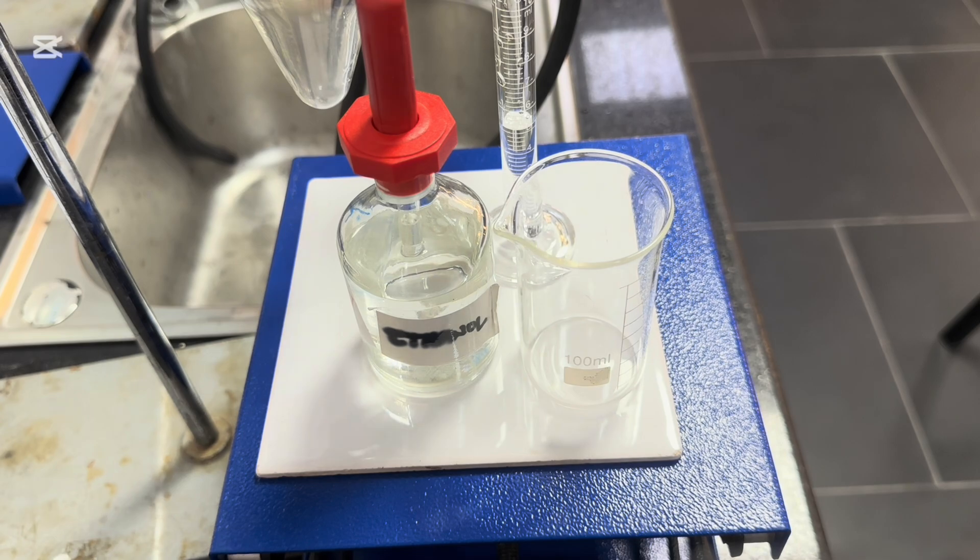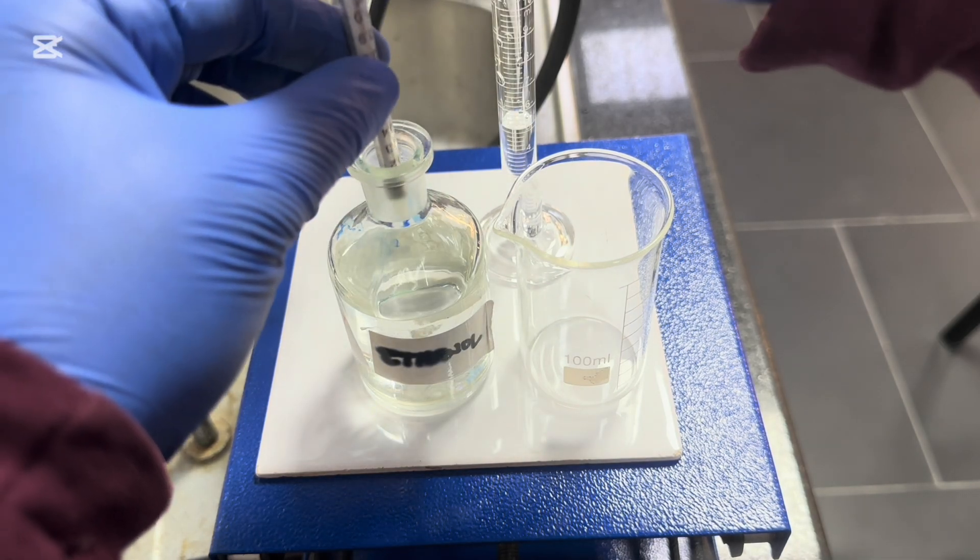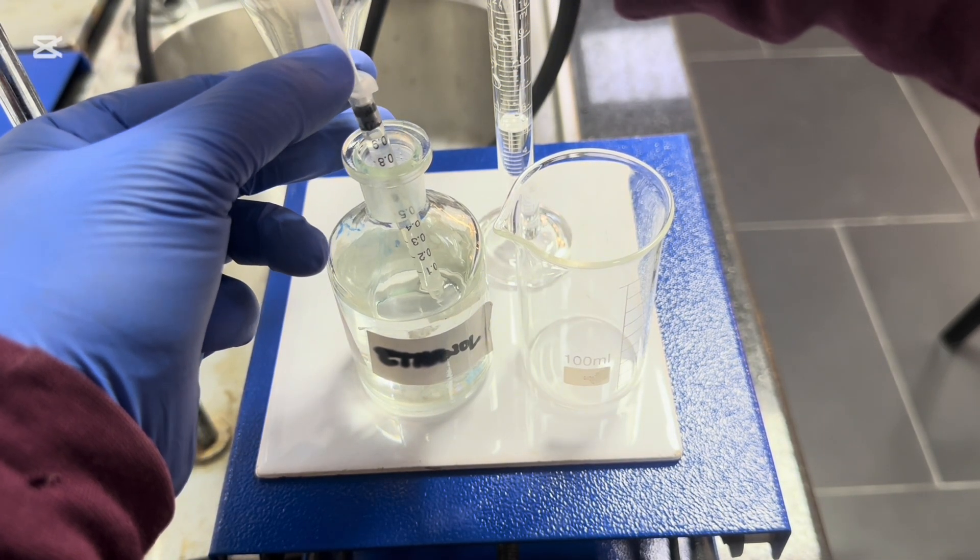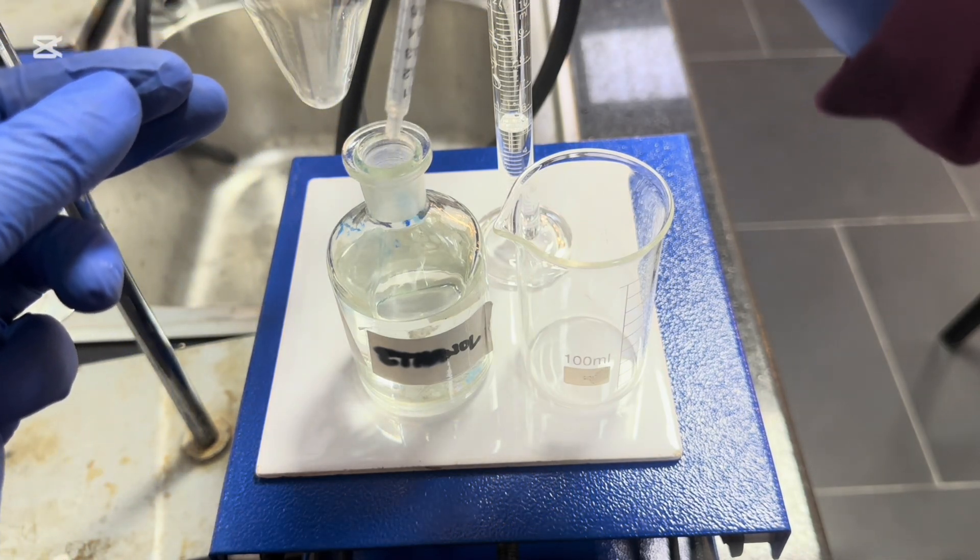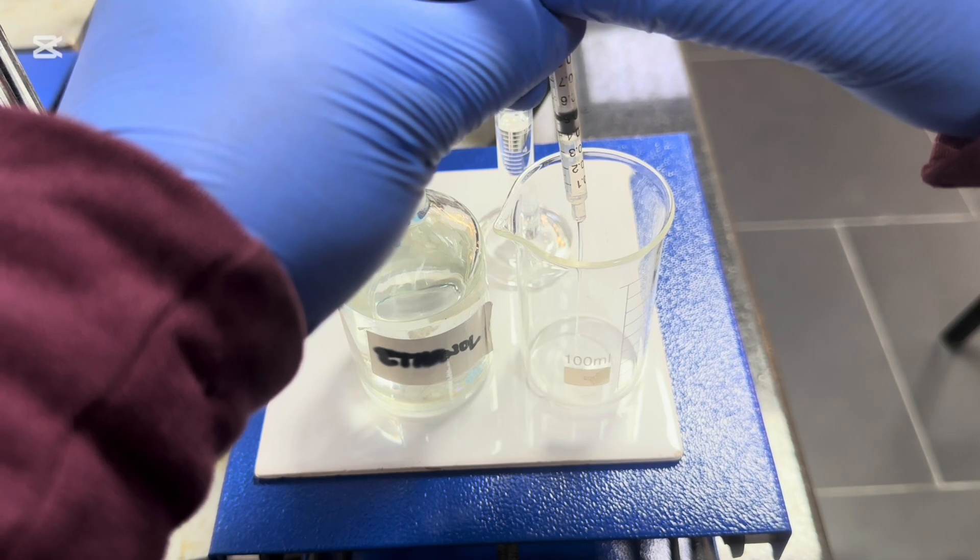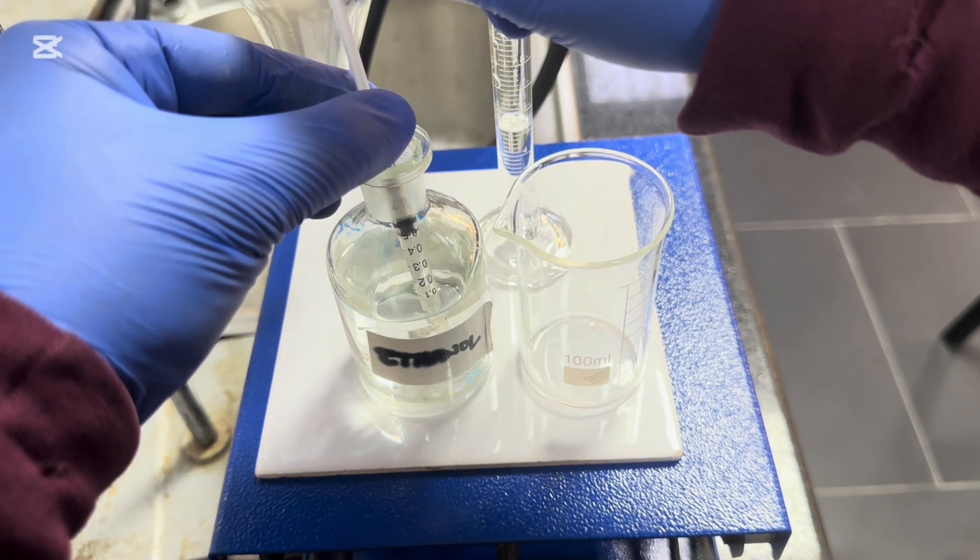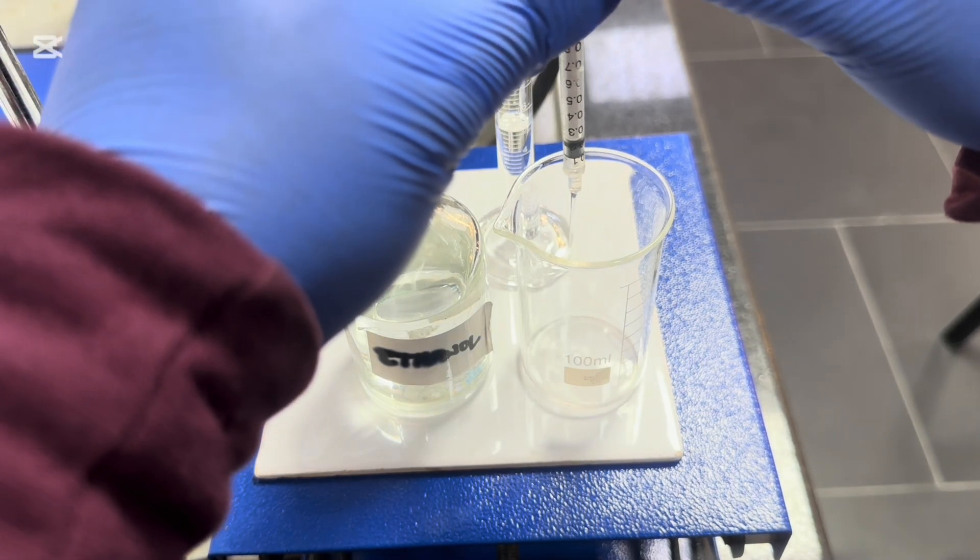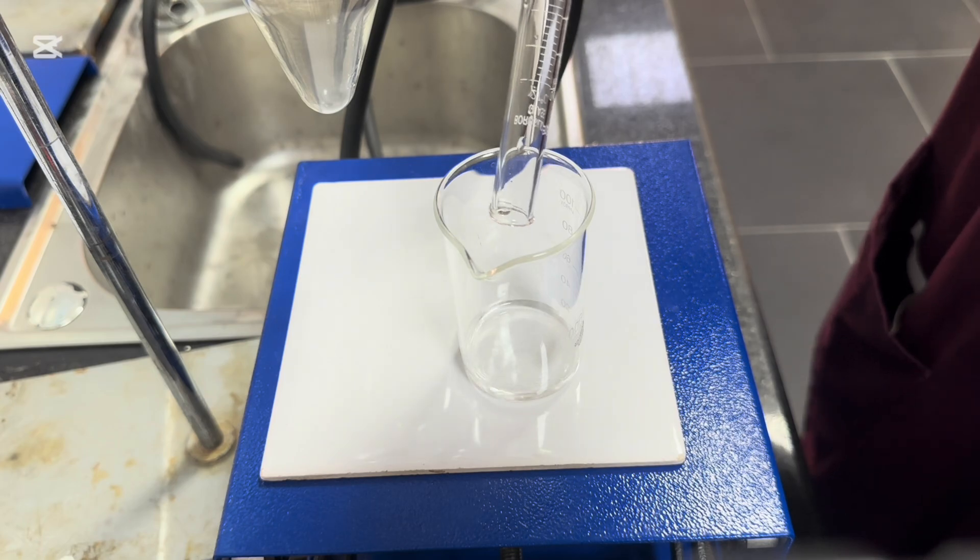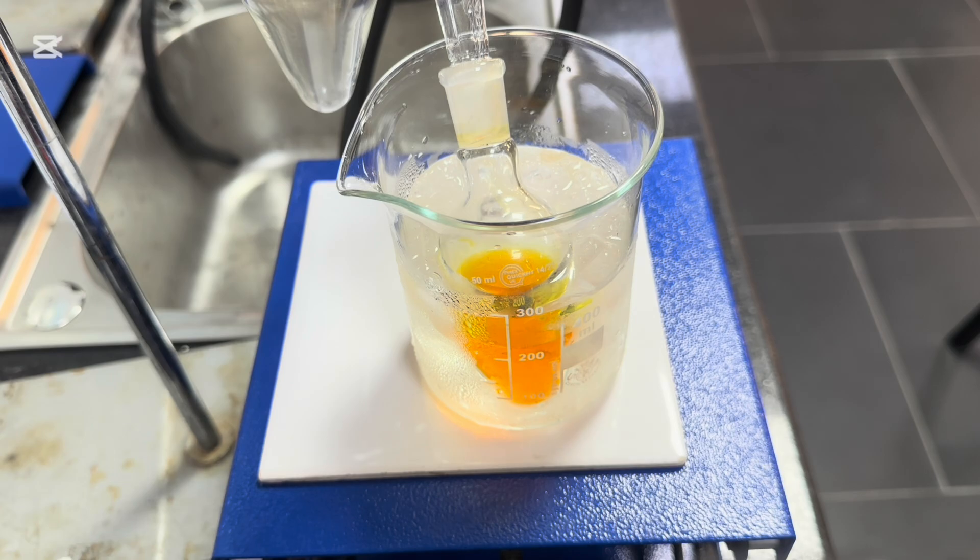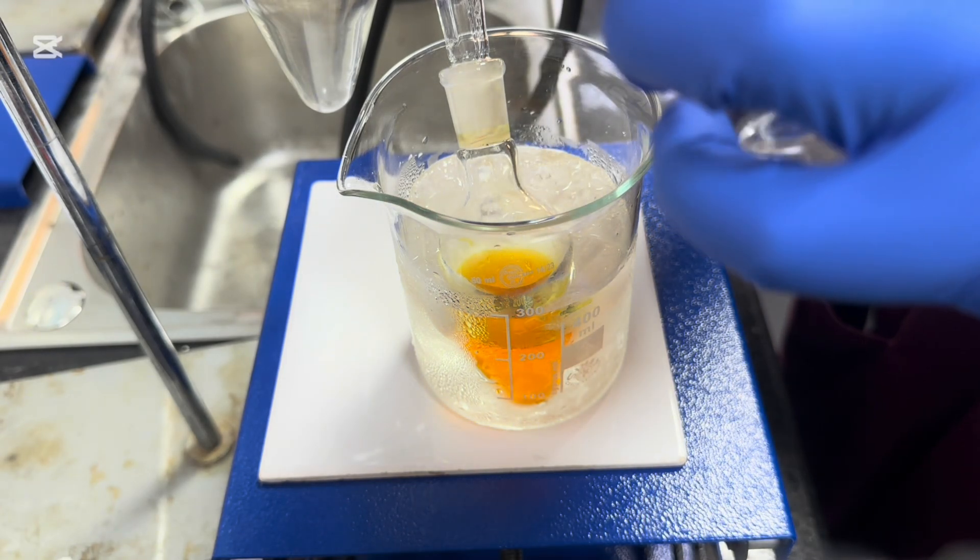And I'm going to then be able to use this syringe to add the ethanol very, very slowly to my potassium dichromate. Now I'm going to set it all up so that the reaction can subside after each addition before I add more. So this measures 1 cm³ at a time. So I'm going to just start off with 1 and then go for half. Top it up with 5 cm³ of distilled water. And now I'm going to add very slowly, using my syringe, the ethanol solution.